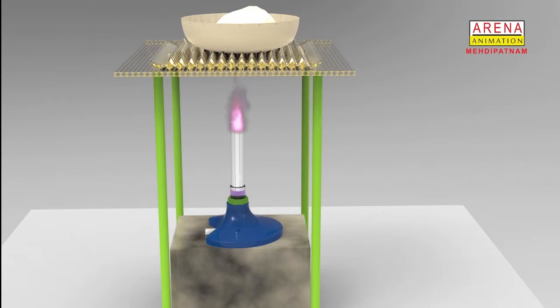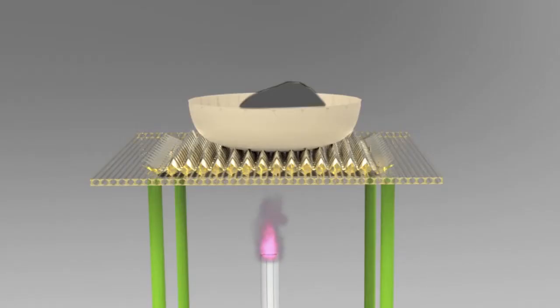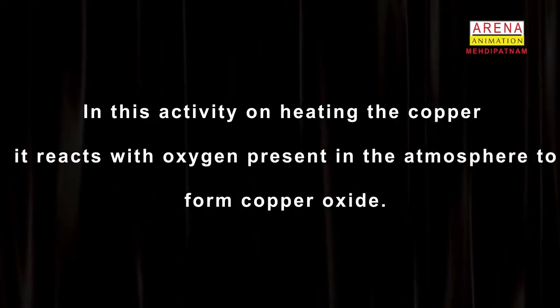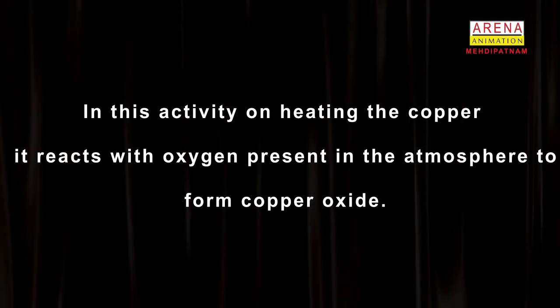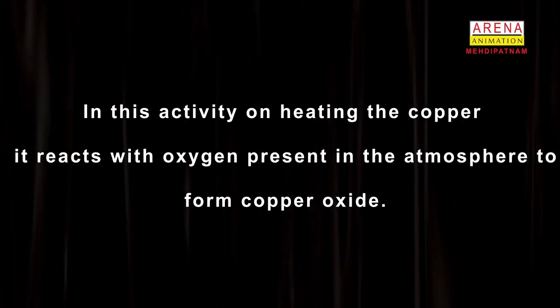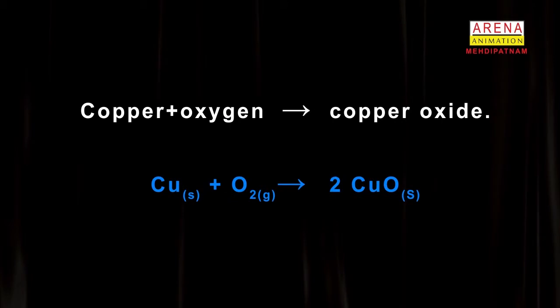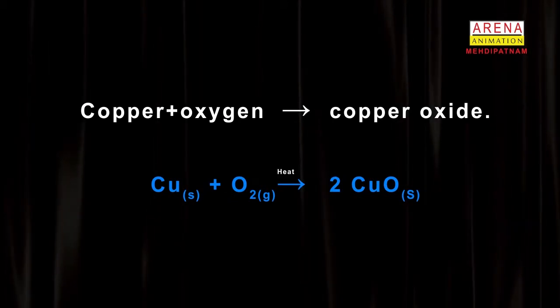By heating the copper powder with the Bunsen burner, do you observe any color change in the copper powder? We will notice that the surface of the copper becomes black. In this activity, on heating, the copper reacts with oxygen present in the atmosphere to form copper oxide. The reaction is as shown in the video.